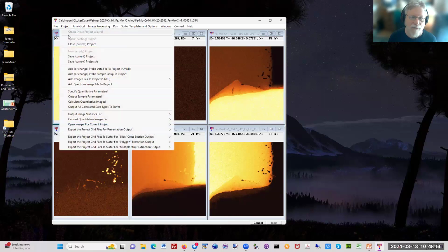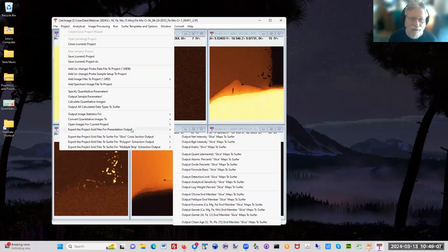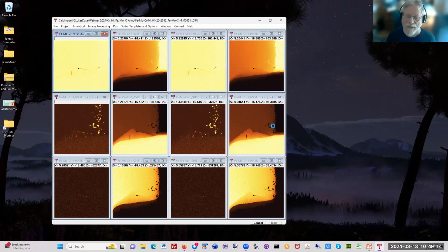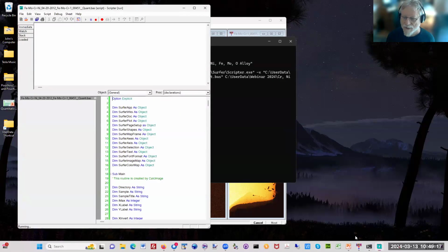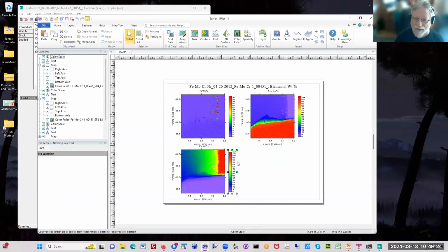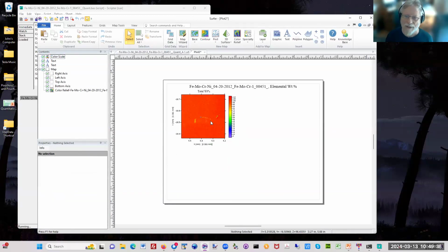And then I'm going to do something really quick just before I take a break here, which is export these files to our scripting software, Golden Software, right here. I'm going to say create some beautiful presentation output. I'll say yes, run that, and it will take these maps and run a script, and you will see that here. It's basically going to load each quantitative map along with a weight percent scale bar. These are saved to a file that you can modify and customize for your publications or presentations. And here's the total map right here. I think I didn't have it checked, but you can also do the backscatter and secondary images also.